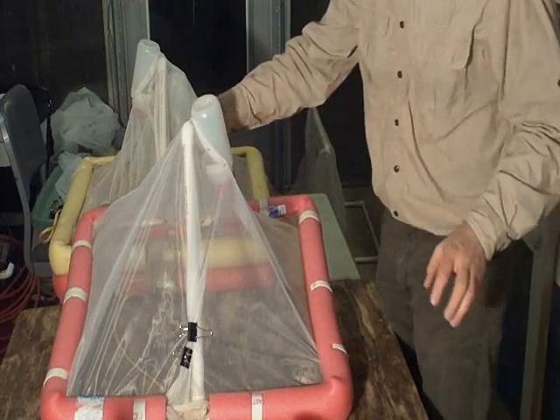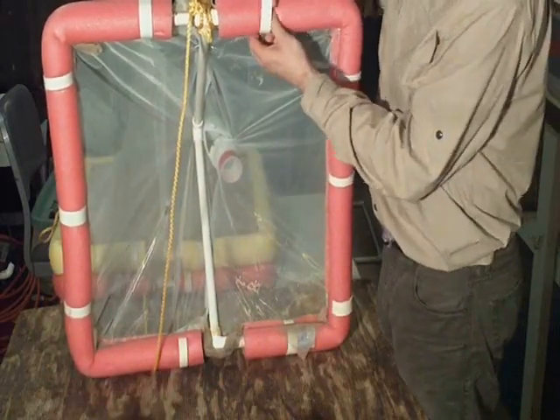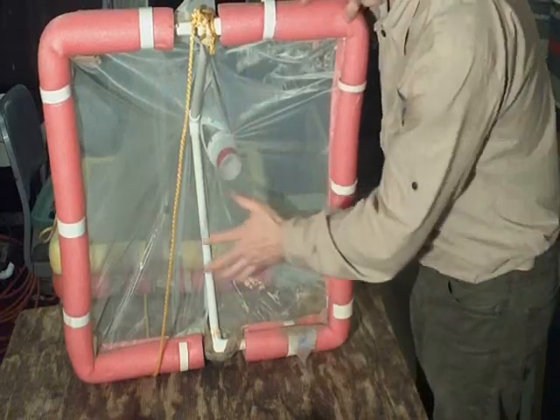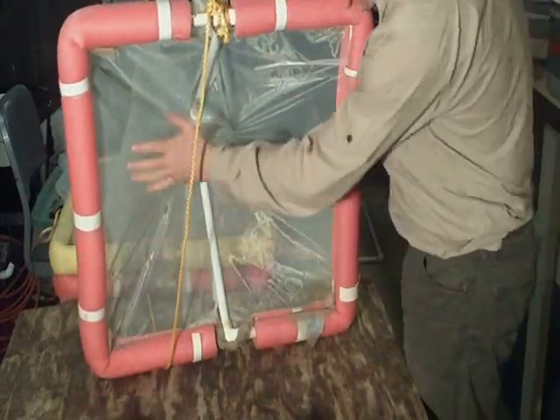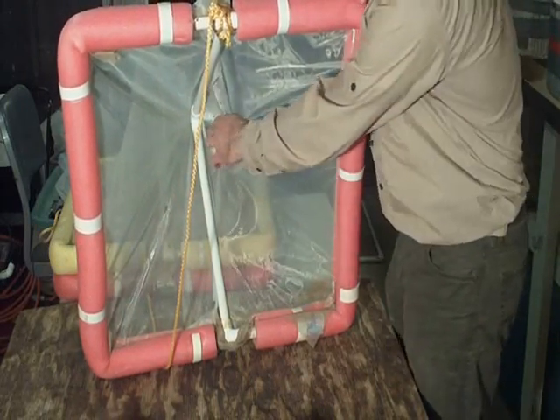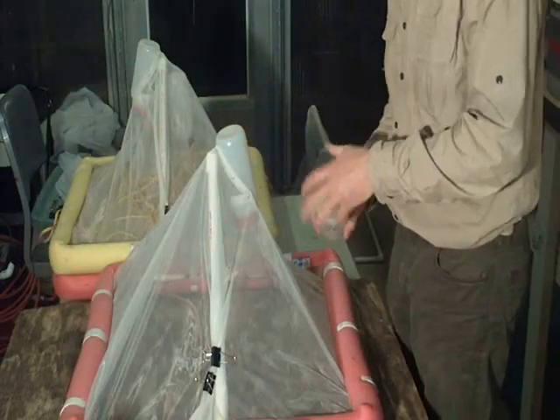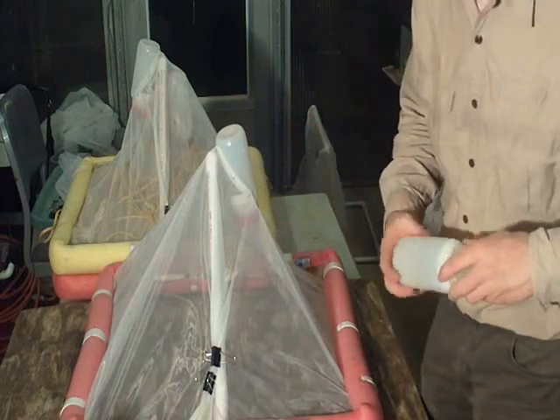The nice thing about all of this is the parts are identical. They're cheap. You can buy them at the hardware store. Let's just take it apart so you see how it works. First of all, there is no hammock. In Colvin Baxter and Dr. Fausch's version, there's a hammock where organisms can sit. We didn't want that. We just wanted them going straight to the bottle. So as you can see, it's just a nice little pyramid funnel shape. Boom, they come up into that bottle, and then they fall in. You can either use a kill strip or you can use ethanol, okay?